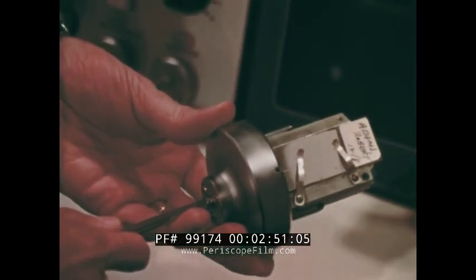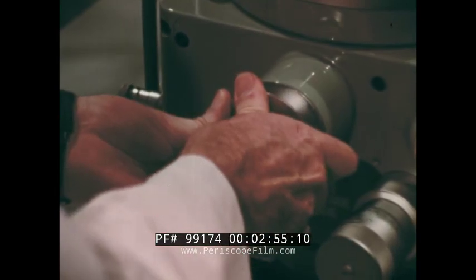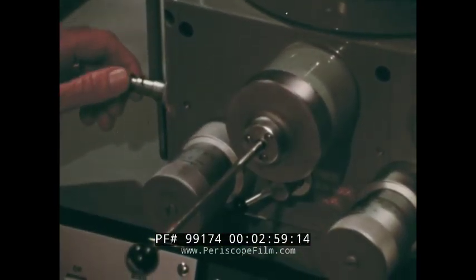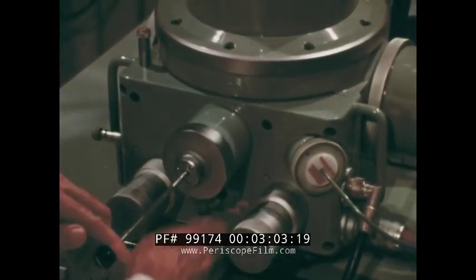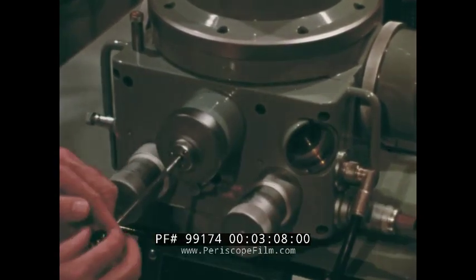The whole slide, not just a tiny fragment of it, is inserted into the airlock chamber. The position of the slide can be observed through an airtight port in the column of the instrument, so it can be checked and adjusted.